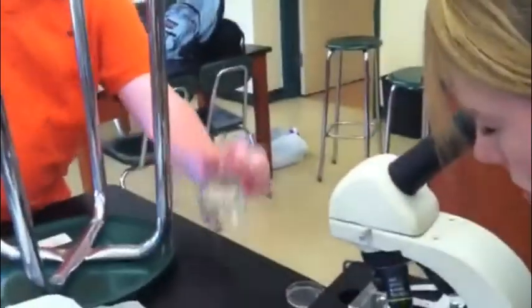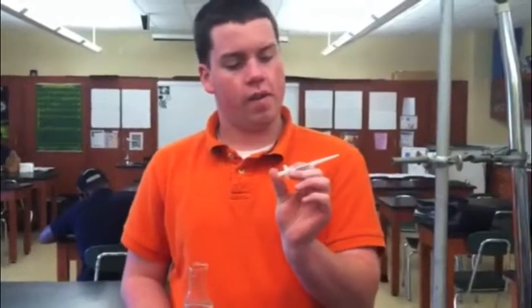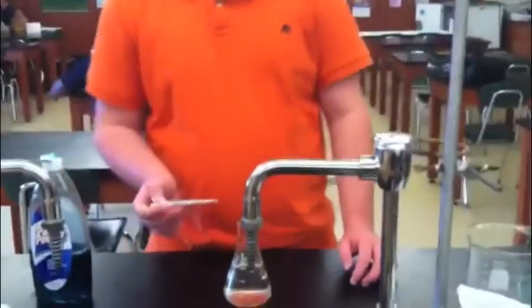Okay, so after producing the chlorine gas, we took a 250 milliliter Erlenmeyer flask and a 1.25 milliliter pipette, and we took some gas out and put it into the water, and that mixes the chlorine into the water to make the water more pure.